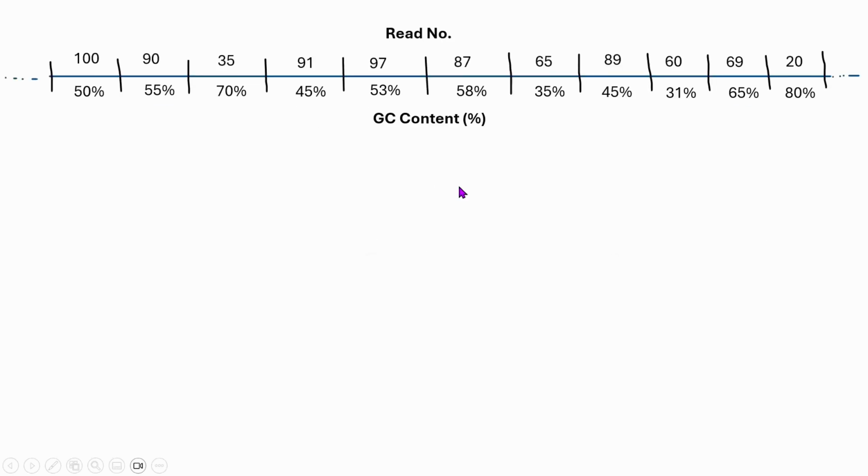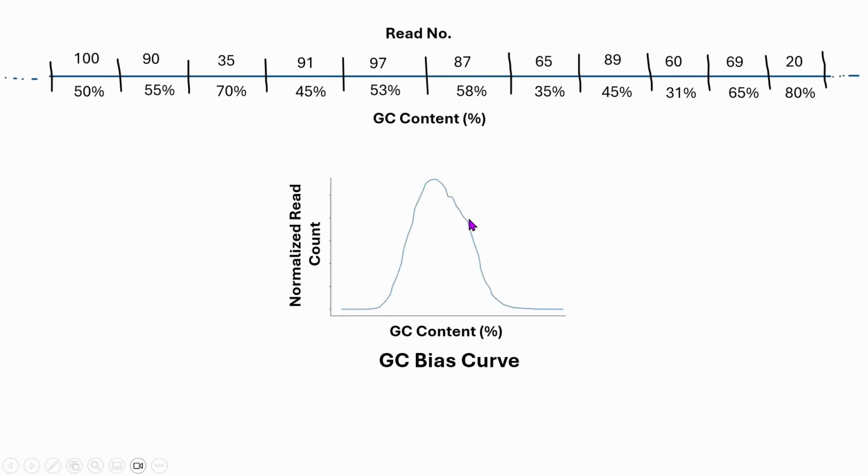So let's see what we can make from this nice little table right here. We can make a curve such as this. GC content percentage will be on the x-axis and normalized read count will be on the y-axis. So what is normalized read count? These are raw read counts. You can divide them by their sum or you can divide them by their mean. So you can normalize them in different ways. But whatever you do, you will be able to get such a nice little bell curve.